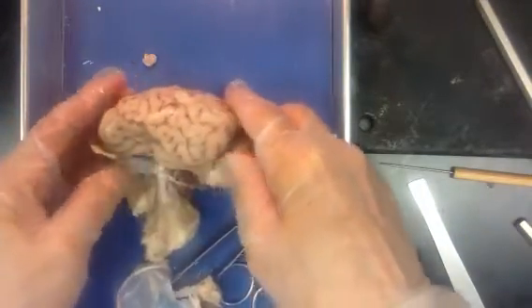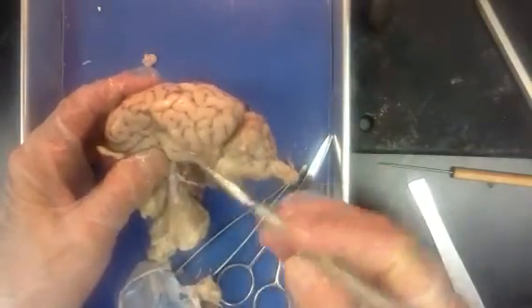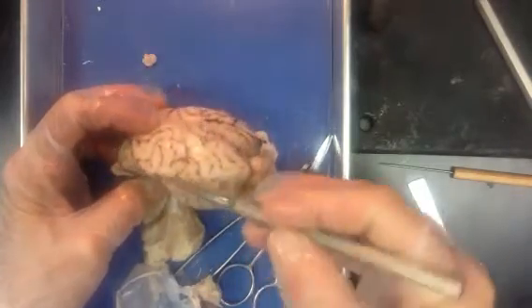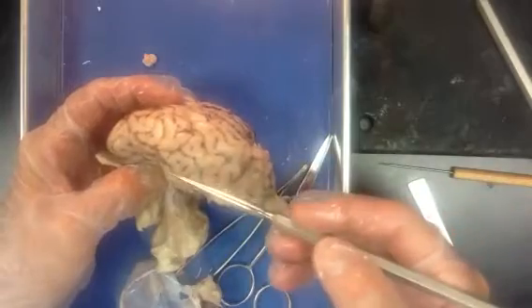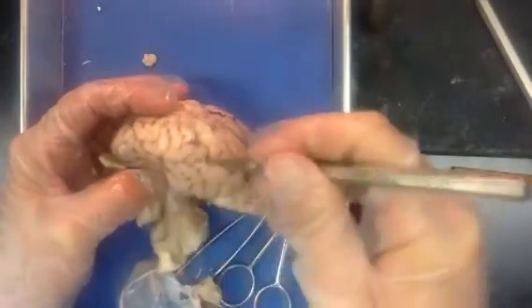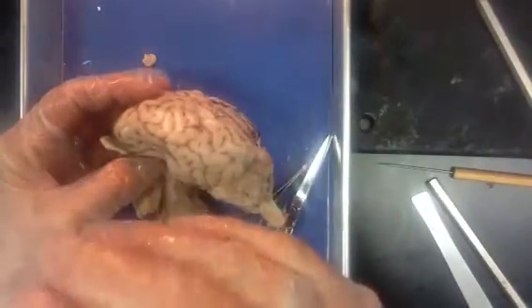And then if you flip the brain sideways, and again, you don't see this quite as well in a sheep as you do in a human brain, there's a groove right here between the temporal lobe and the rest, and that's called the lateral sulcus. Theirs is kind of buried down in here a little bit. That lateral sulcus opens up into an inner fold in the human brain called the insula. It's like an inner layer of more of these gyri.